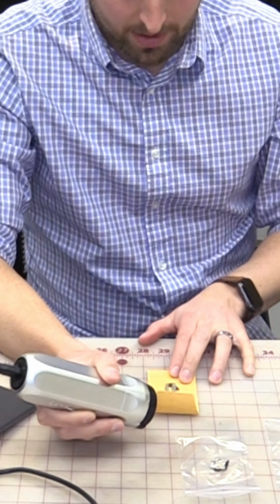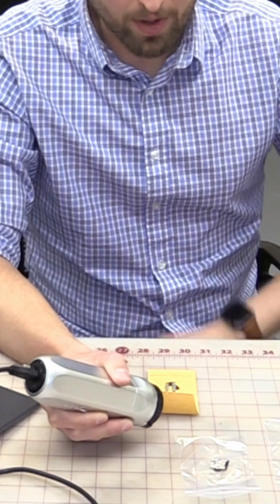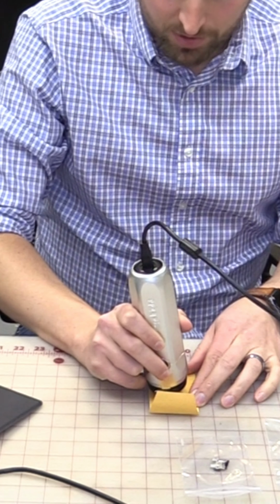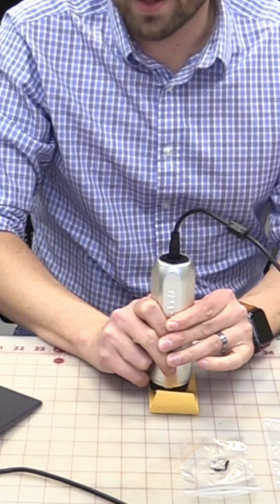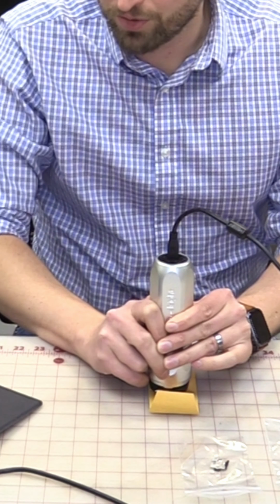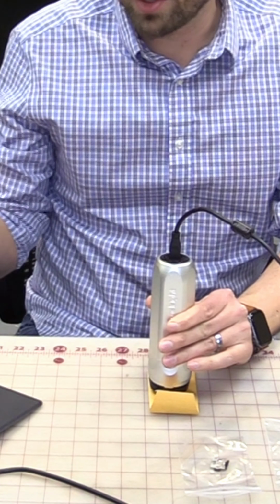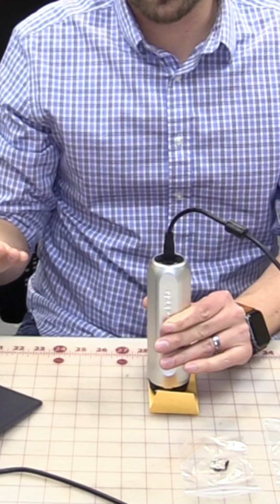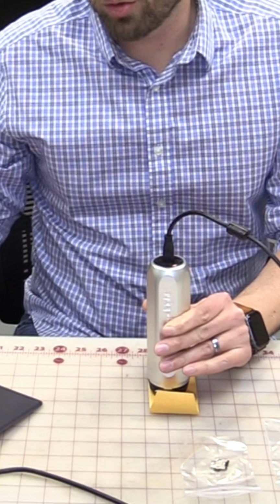And so now we're able to see, well, does this look like an overload scenario? Does this look like a melting scenario? Or is it a third option, something else? If we use the GelSight, we're able to see very quickly that this is something else. This is not melting. It does not have those smooth, soft edges. It's also not overload, because it wasn't just losing the adhesion to the other side of the plate. What we actually see here is what we call solder creep.